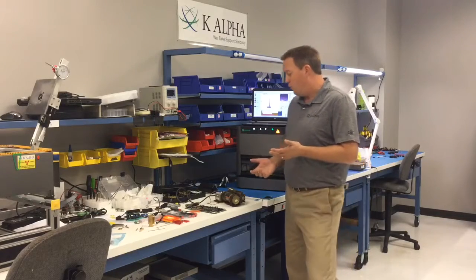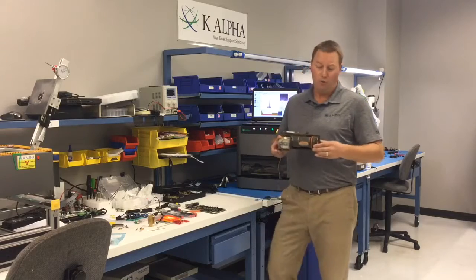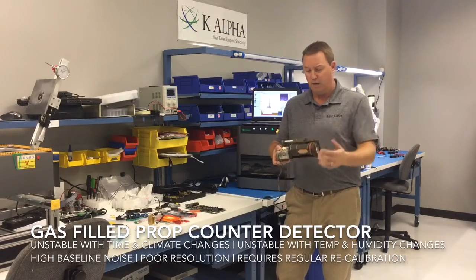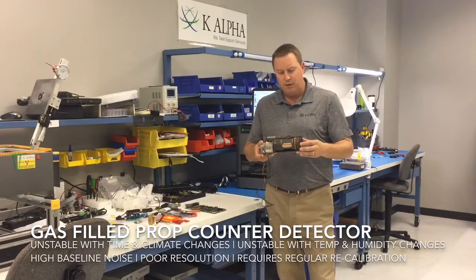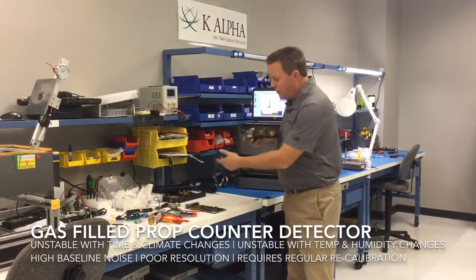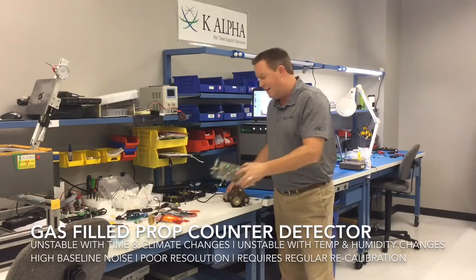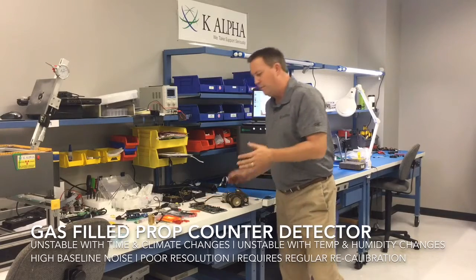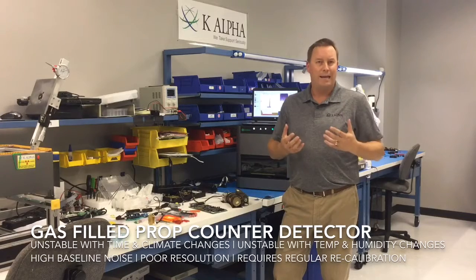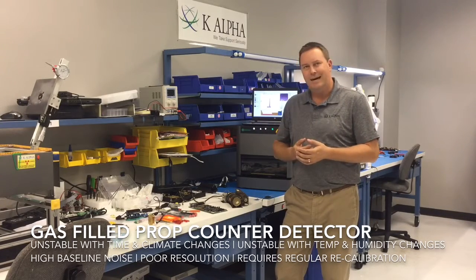In years past, what was mainly used was what we called a gas-filled proportional counter, or prop counter. It is gas-filled. Here's the detector area here. I've got an example. Basically the signal's converted here. You've got a preamp, and all this is connected through wires to an MCA board. One real main advantage of this is it's got a big window. It can collect and handle a lot of photon counts, but it really has a lot of negatives.